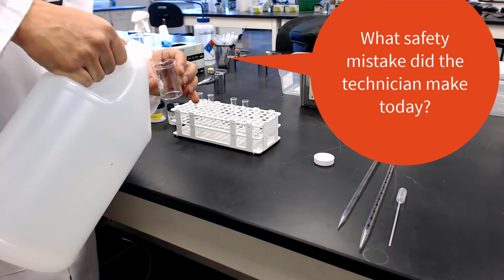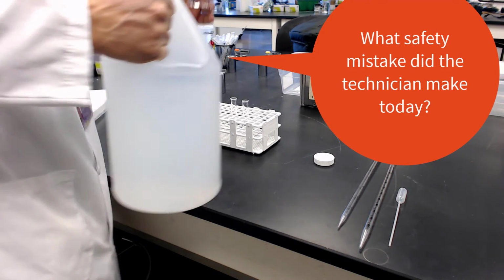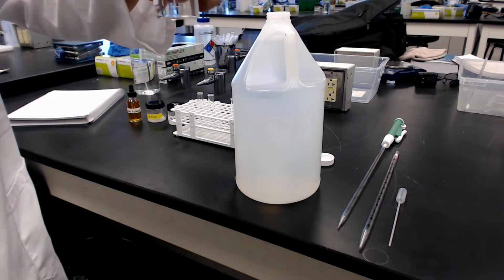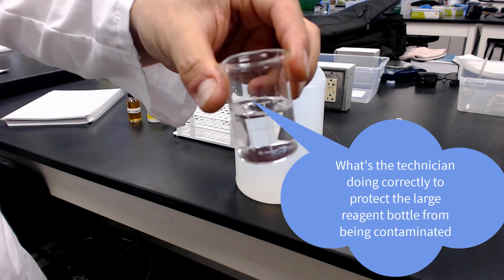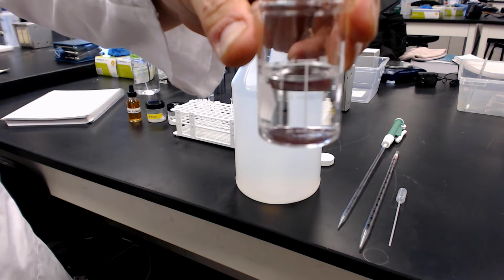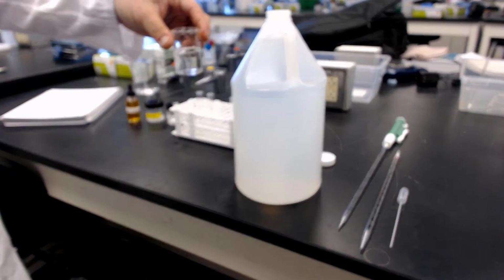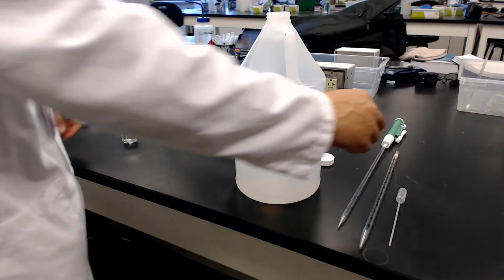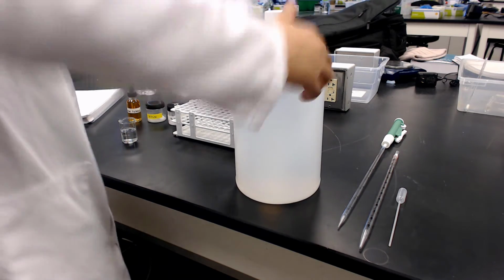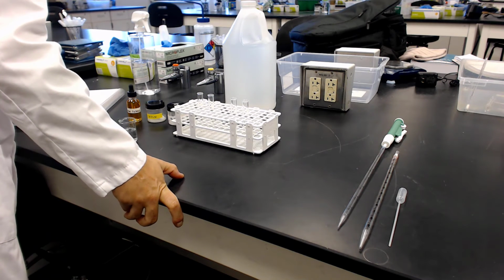Now, one thing technique-wise I would tell you here, and we're just going to mention two things. And one of those is safety-wise, he's not wearing gloves, so that's not acceptable. But the other thing that he is doing right is he's putting the reagent into its own bottle so that way he doesn't contaminate the big bottle. So that's the right way to handle that part. So now we're going to measure out 20 mils. So remember how we go about this.